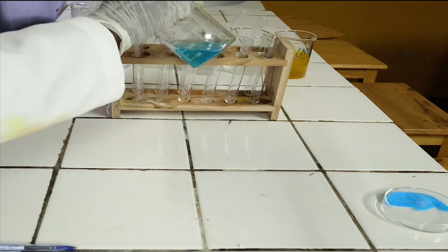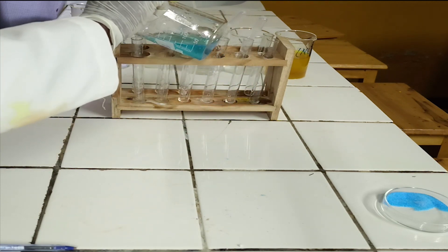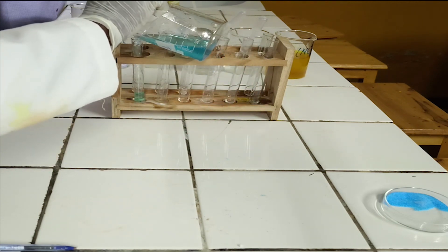Divide the solution into test tubes, putting around 5 milliliters in each test tube.